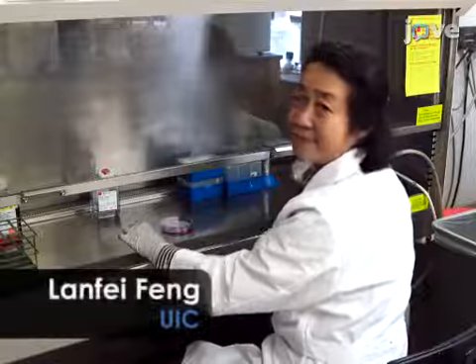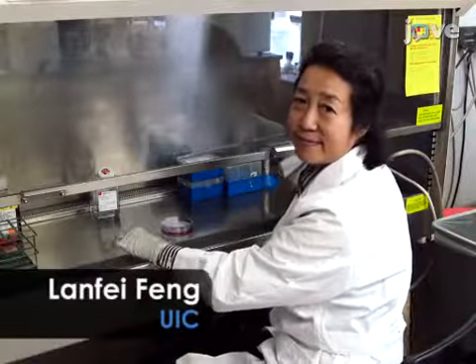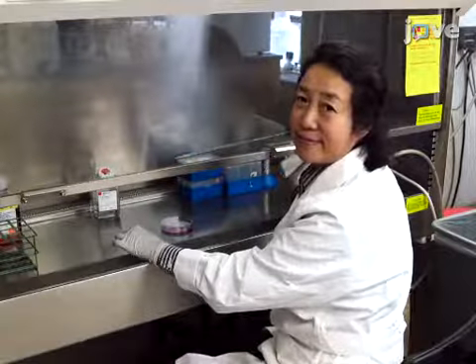The main advantages of this technique are that it is straightforward and inexpensive, and that it can be applied to study biologic effects induced in live cells following their interaction with neighboring cells undergoing apoptosis. Demonstrating the technique will be Lanfei Feng, a technician in my laboratory.